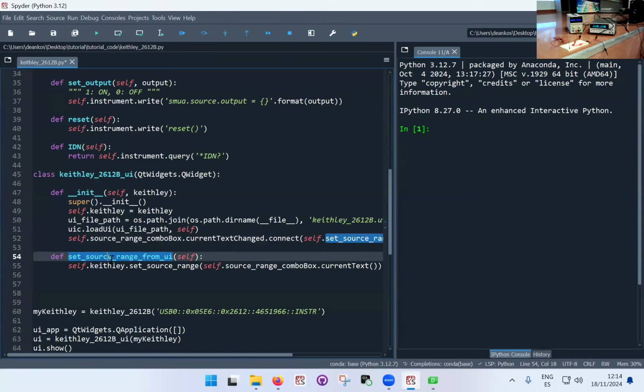What is the difference between index change and text change? So what can happen is that I can change these things programmatically. In principle, whenever you change the index, the text is also changed. But it might be that for some reason I have two options which have exactly the same text. So in this case, the text wouldn't have changed because the text is the same for two options. So it really depends on what you're implementing. In my case, it's completely equivalent.